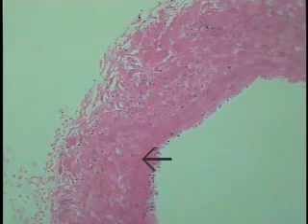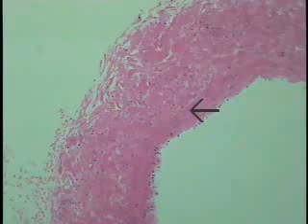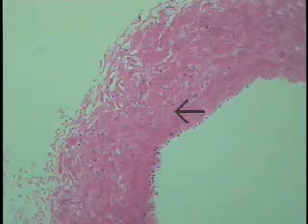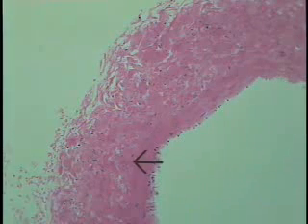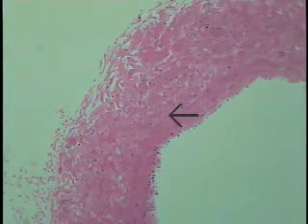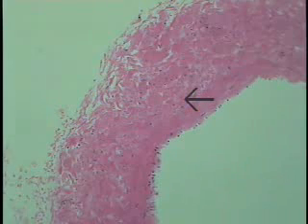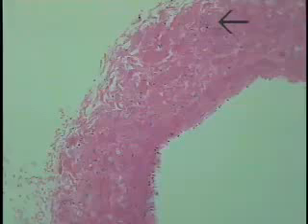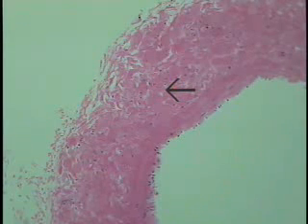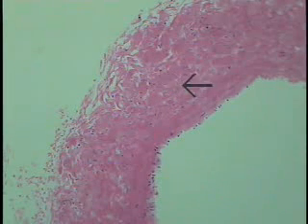Now the tunica media, depending on where you are in these large vessels, may be present as indicated here and has smooth muscle within it, or in some places there are gaps, it may even be absent in these large vessels. By far the most substantial component of the wall of these large veins is the tunica adventitia. It consists of longitudinally orientated or spiraling collagen fibers primarily. It will also have elastic tissue following that similar course, and if one looks closely, we'll find bundles of smooth muscle also with this longitudinal orientation, forming a loose open spiral around the lumen in the adventitia as it spirals around towards the direction of the heart.